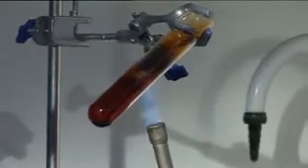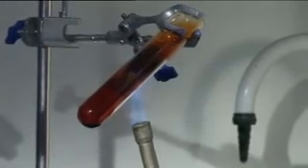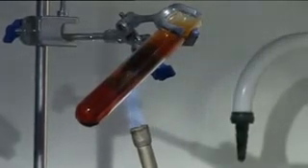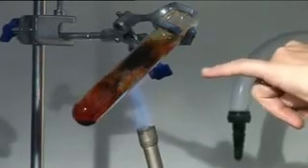And what we should see, once we can get the iron wool hot, is that it starts to react with the bromine vapor. At the moment all we've got coming out of the top is bromine fumes and there you can see the glow and the reaction.